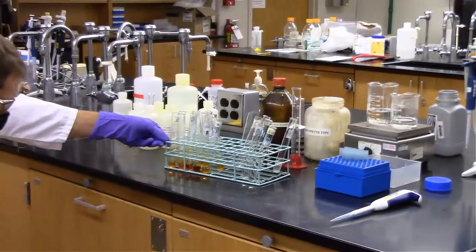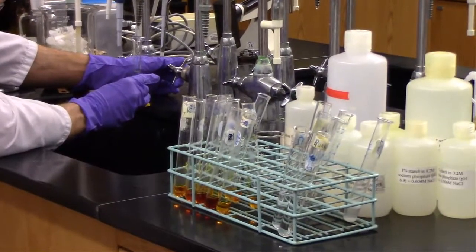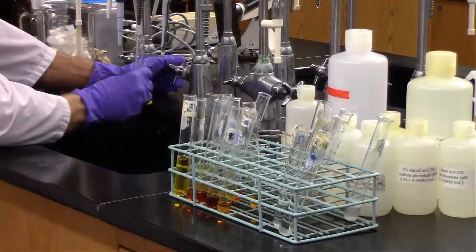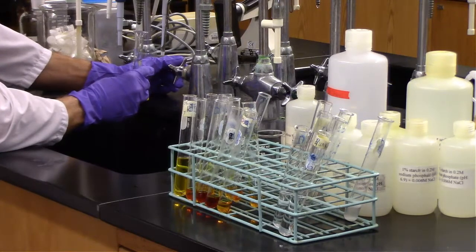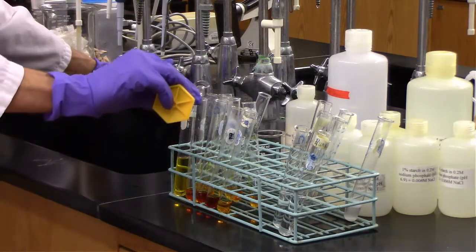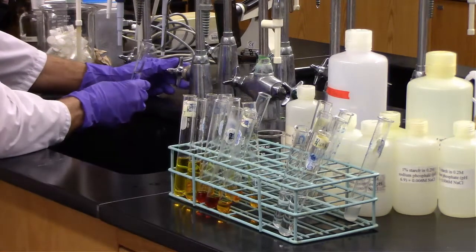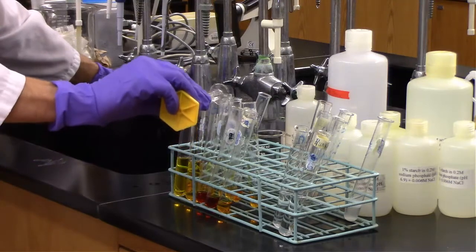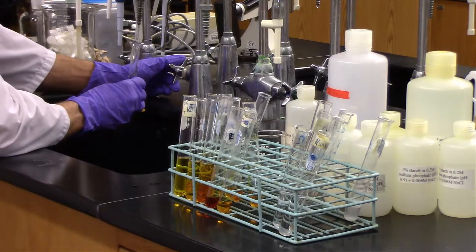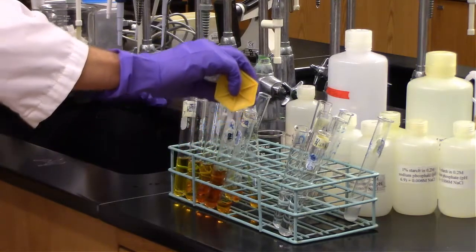And it looks like that is what we're seeing there. We need to dilute these with water to give a better idea of what we're referencing, but it looks like for our pH 4 and pH 10, there's very little reactivity. For our mid-range ones, so pH 6, 6.9, and 8, it looks like we definitely had some activity. Now after diluting that first one, it looks like it was actually relatively low. Even the second looks kind of low. But we'll have a better idea once we take the absorbance of each of these samples.